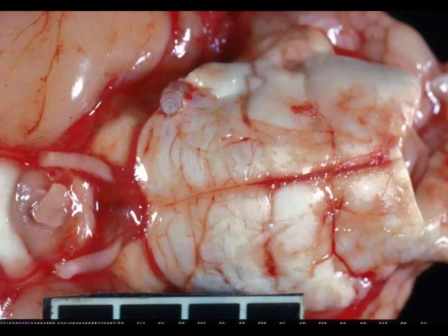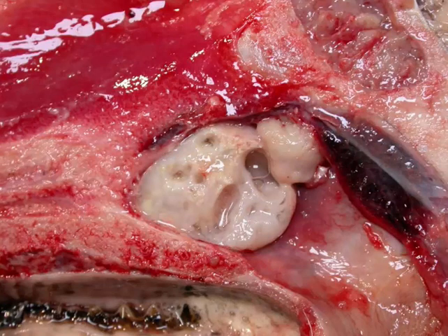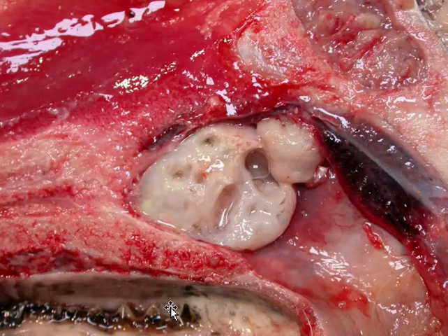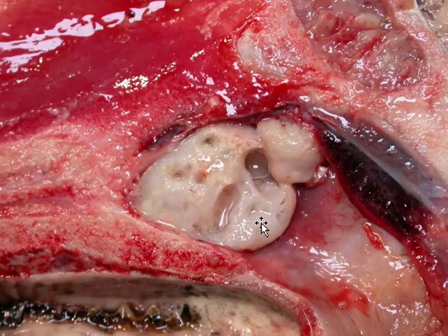It is our last slide before Christmas, so let's do well. This is tissue from a sheep. I would like a morphologic diagnosis and a cause. Okay, time's up. We're looking at the sinuses of a sheep. Not a whole lot of stuff happens in the sinuses of a sheep.